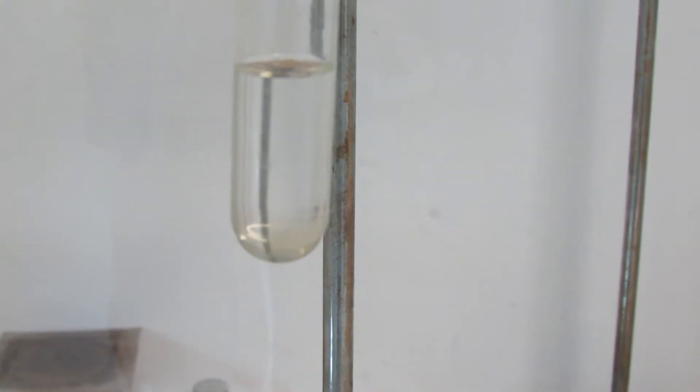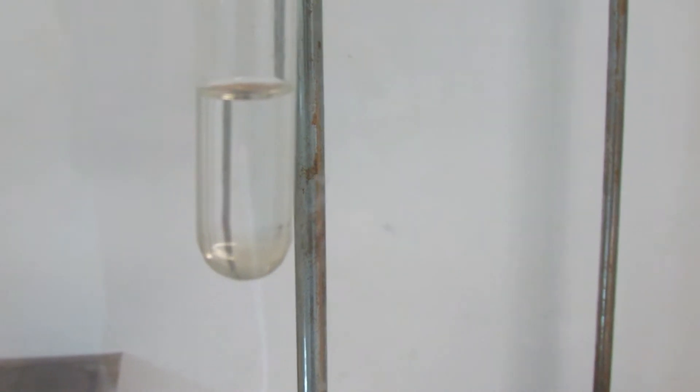Hey guys, this is Gopher King and I'm making a quick video here. I have some 91% isopropyl alcohol in that test tube, and underneath it you can see I have a little layer of sulfuric acid. I just injected that under there with a little pipette.